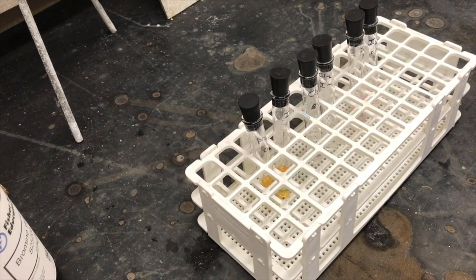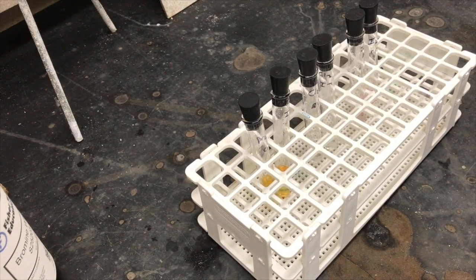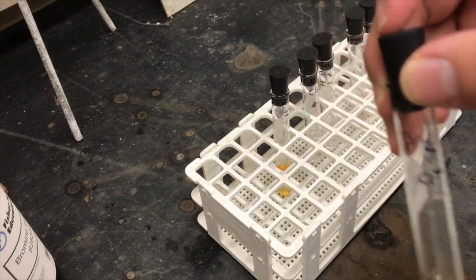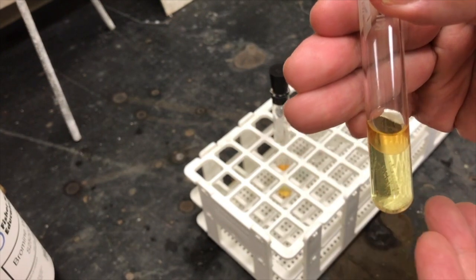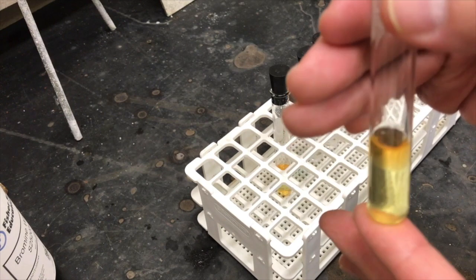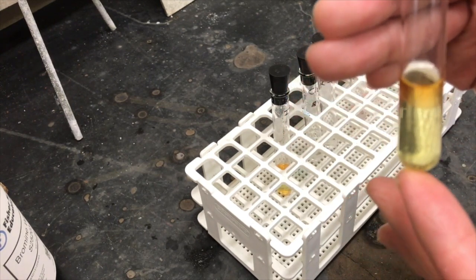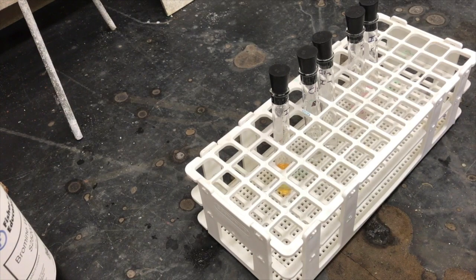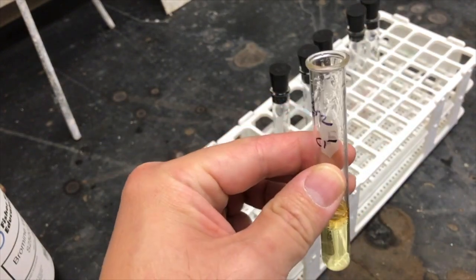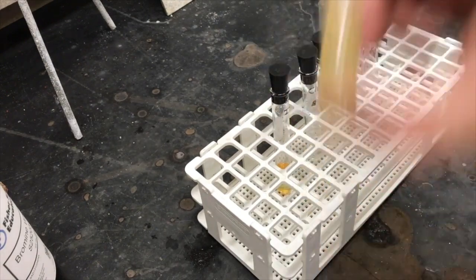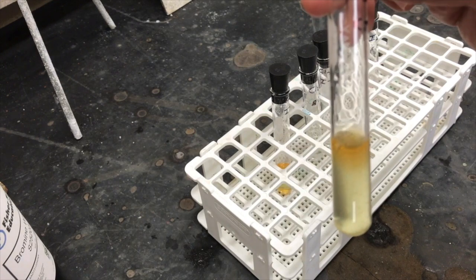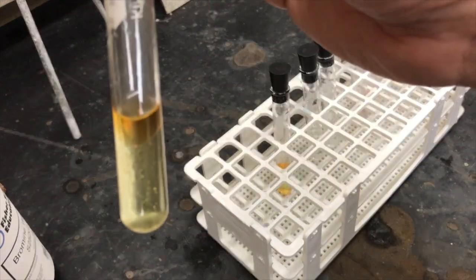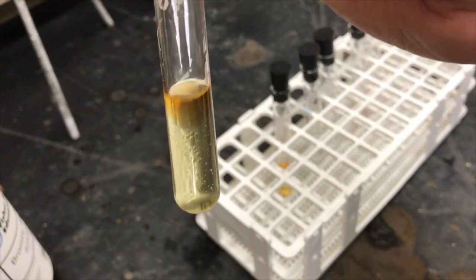Okay I'm going to start the reaction with the halogens and the halides and so this is your data table that shows the cross between the halogens and the halides. I'll start with this first tube here which already contains bromine, bromine and water and hexane. So we see the hexane layer on top which is orange and the yellowish aqueous bromine on the bottom. So I'm going to add sodium chloride and we're going to shake and see what happens. And so the results are that top layer the hexane layer is still orange with bromine and the bottom layer is still yellow aqueous so no change.